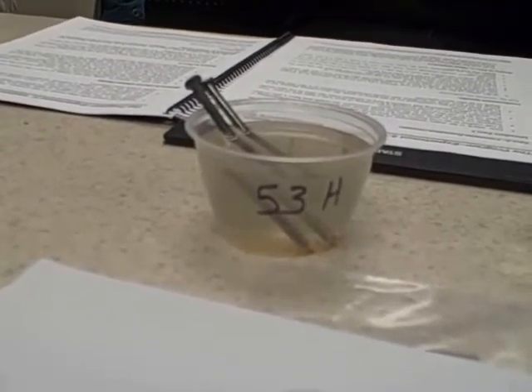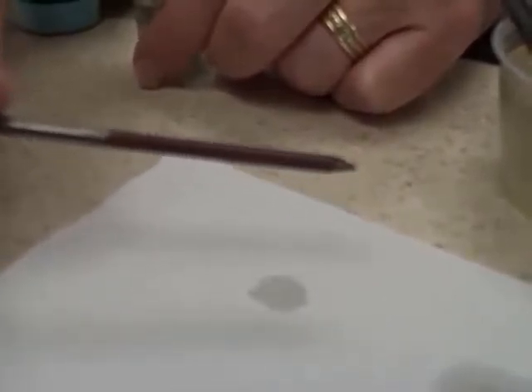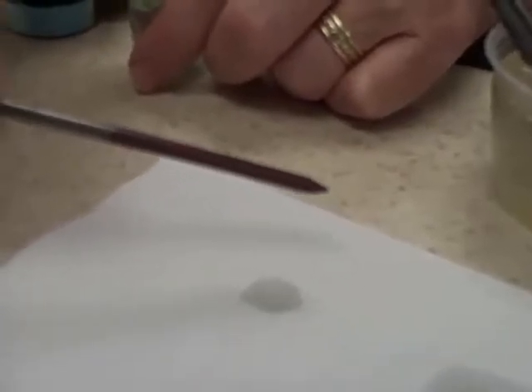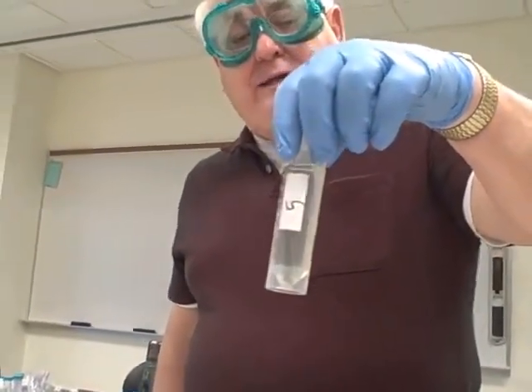Let's go back to the vial with the nail in it. What's happening to the nail? Getting a brown coating. It's getting brownish, a brown coating, and that brown probably is copper. So that's another way of coating one metal with another. We started, where's the silver nitrate? What do we do with that? Here it is. We started over here putting copper into silver nitrate.